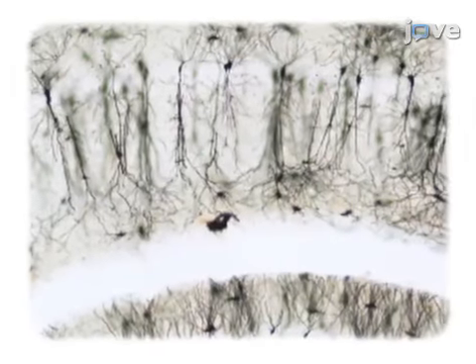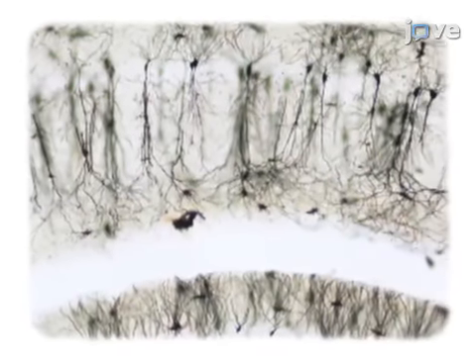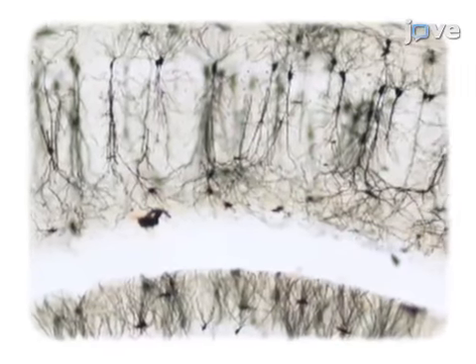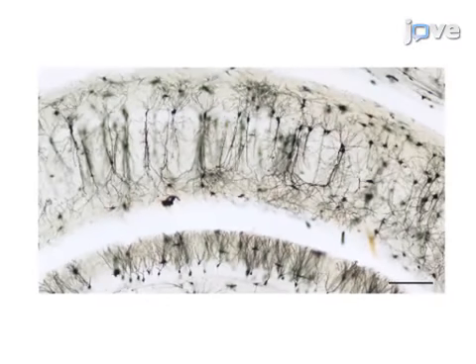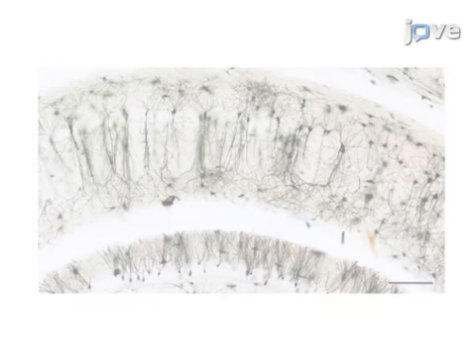Finally, a panoramic method is used to stitch multiple high-magnification images together to yield one high-resolution composite image for qualitative and quantitative assessment of dendrites in the entire region of interest. Demonstrating this procedure will be Mojabi and Ponnusamy, research fellows from my laboratory.